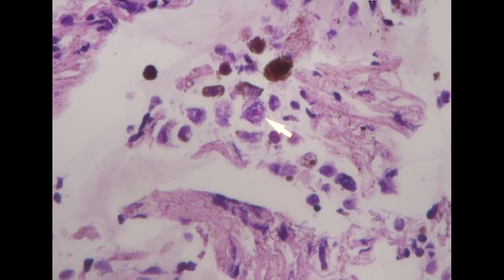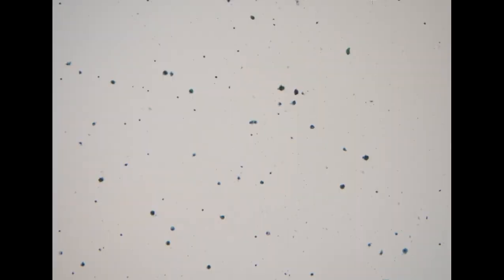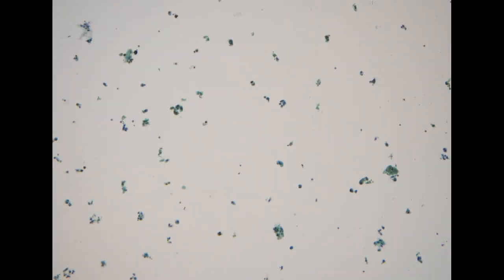It doesn't look like a histiocyte, so it is not a melanophage. So this is malignant cells. So we call this type melanoma. Just within these months, we have had 2 eye melanomas. That is kind of unusual, but because we are now in a large tertiary hospital with a lot of specialized doctors, we are getting some more strange specimens that we don't usually see.